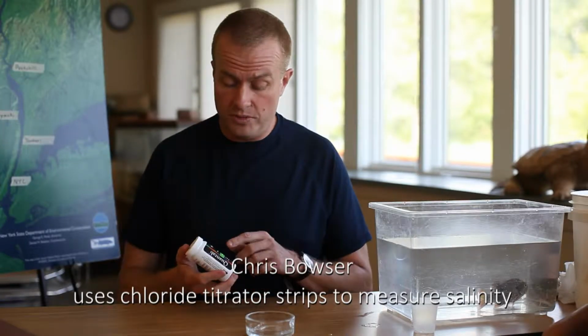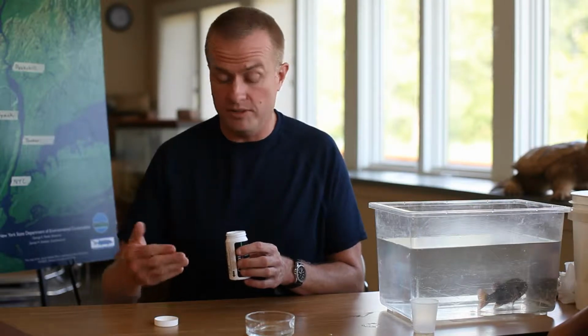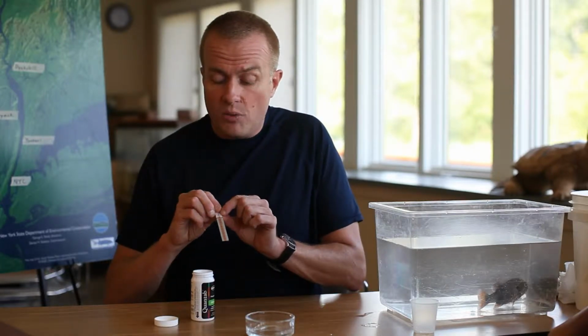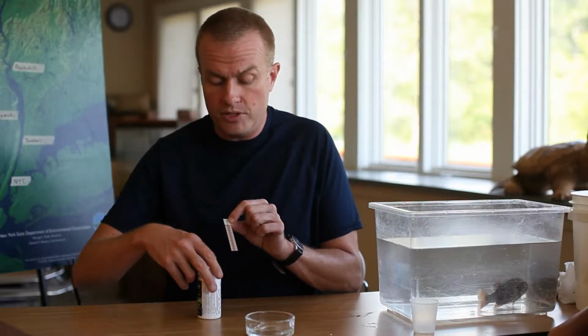Now we're going to use a different device, little titrator strips called quantabs, that will measure the salinity or the chlorides in fresh water, or water that's nearly fresh. This is great for measuring very low levels of chlorides that you might find in tributaries of the Hudson or the upper Hudson River. We're going to take out one of these little quantab strips, and we're going to be very careful to hold it at the very, very top above the numbers.